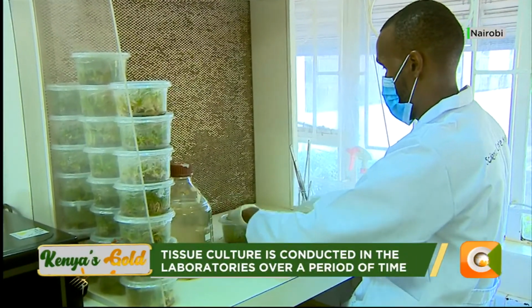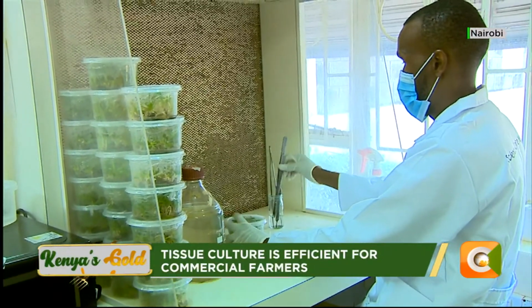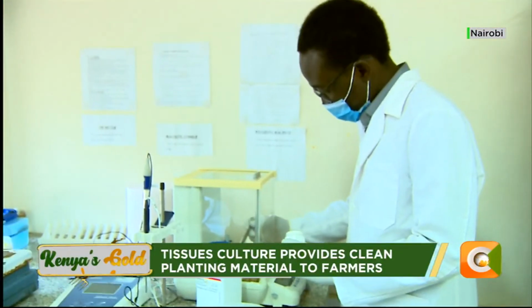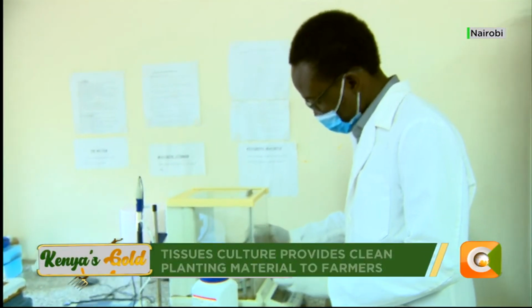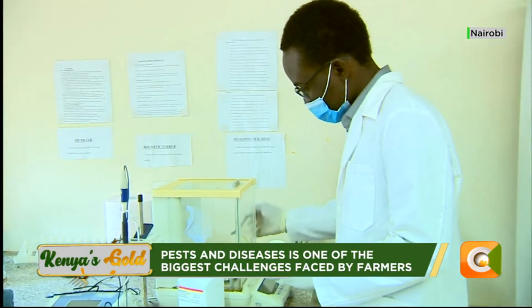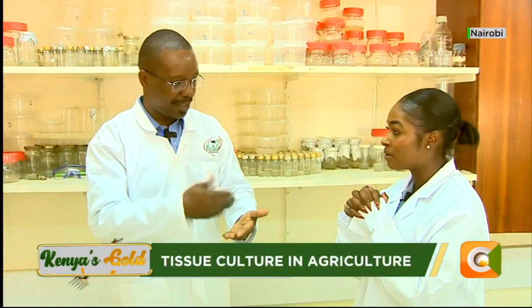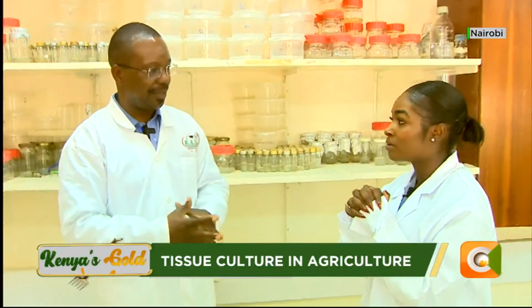And the other things are just the normal ways of maintaining the sterility of the environment: cleaning using ethanol so that you sterilize the environment, and also maintaining cleanness of ourselves, dressing properly, and sometimes, like during COVID, using the mask. Remember the mask? So when you're doing the propagation, you also have to wear the mask. In that case, you are not contaminating the material you're dealing with. So that's the level of sterility that is required.